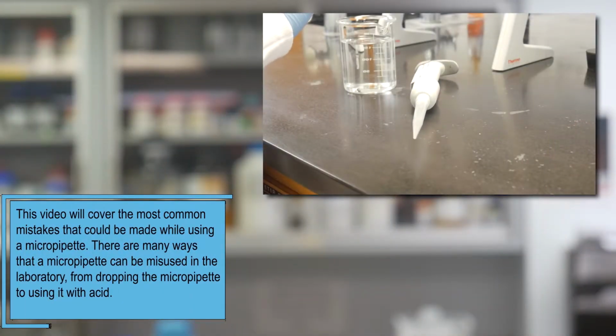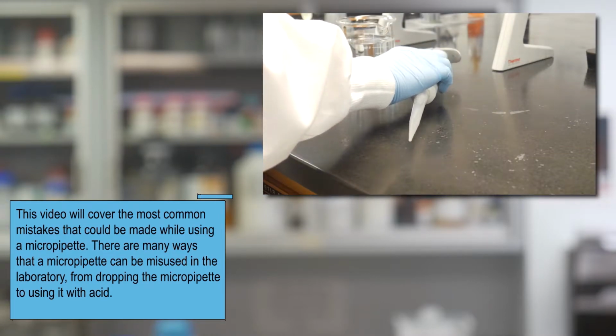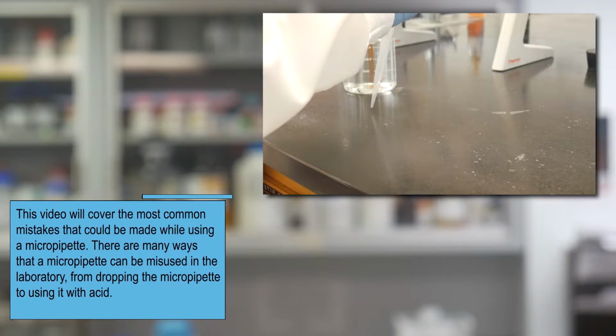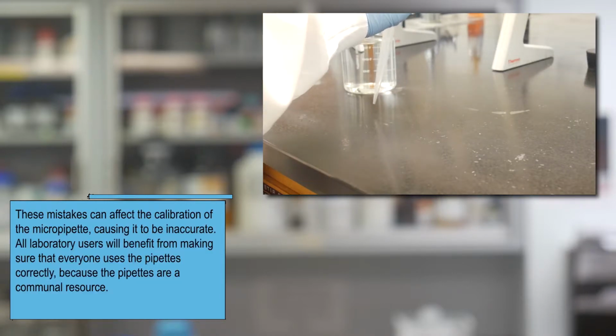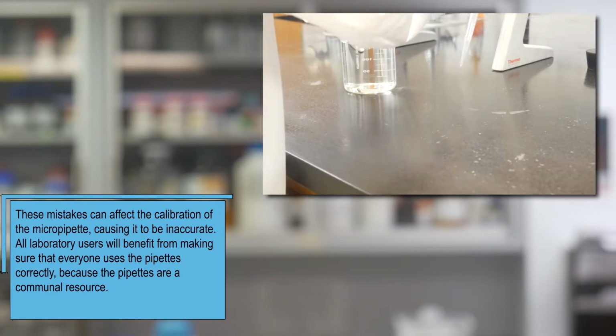This video will cover the most common mistakes that could be made while using a micropipette. There are many ways that a micropipette can be misused in the laboratory, from dropping the micropipette to using it with acid. These mistakes can affect the calibration of the micropipette, causing it to be inaccurate.